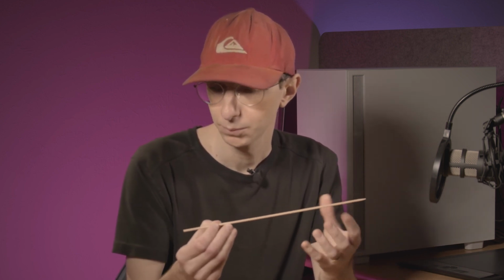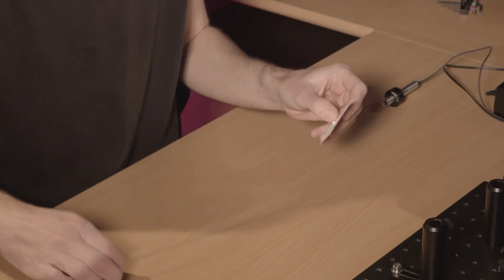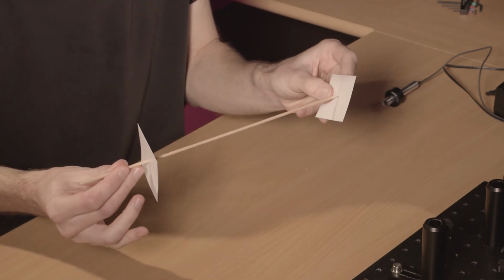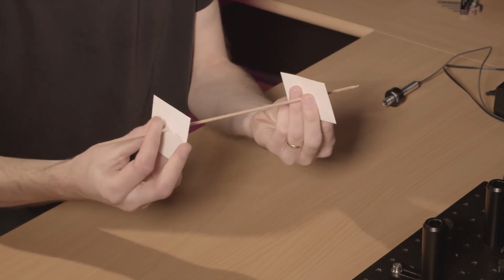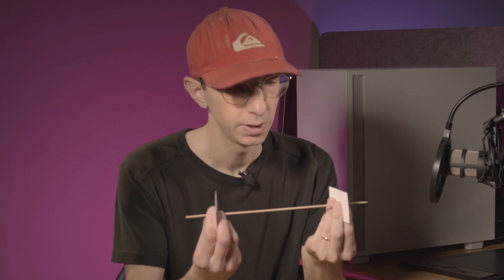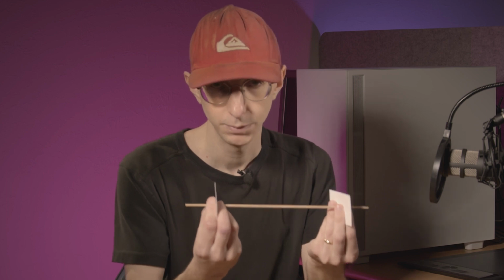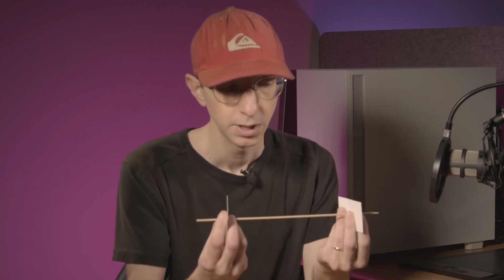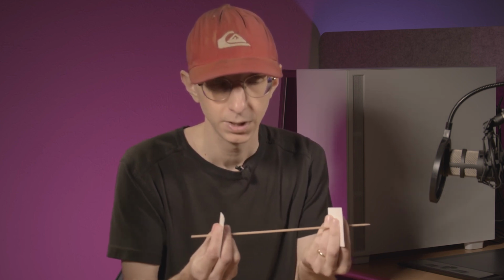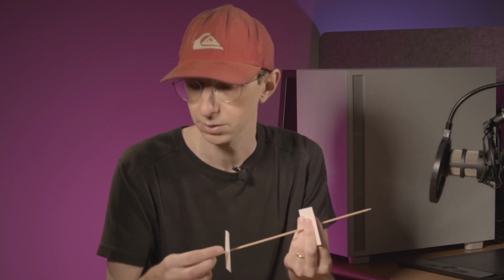So to define its position, I will use two apertures like these and make the laser pass through the two apertures. And we see that moving one of the apertures up and down or left and right will tilt the beam, while moving the two apertures together will shift the beam position in space. You will also see that rotating the aperture has no effect on the beam, the same as getting the two apertures closer together, it's not changing the beam as well.